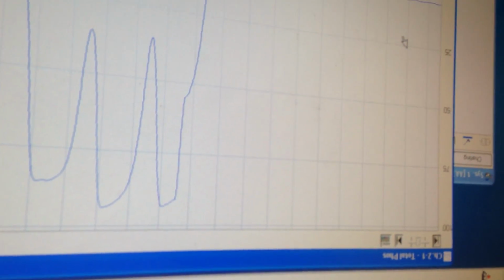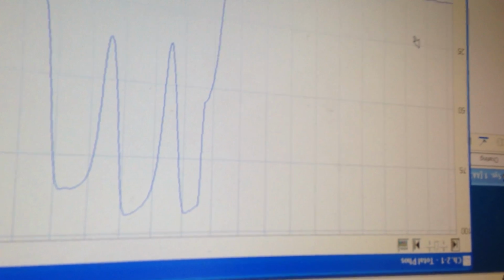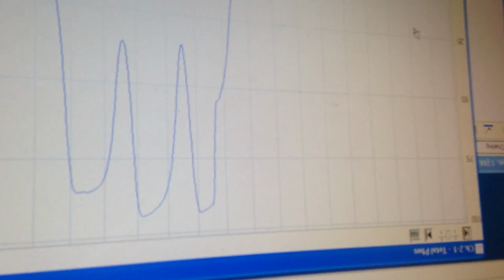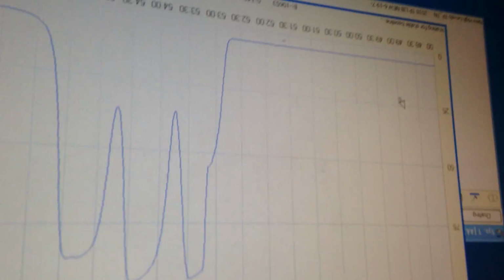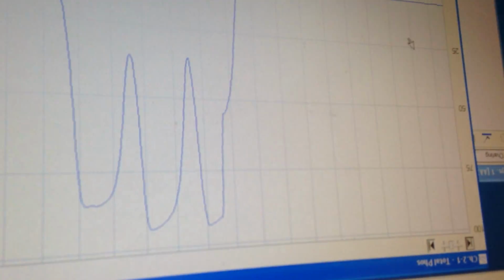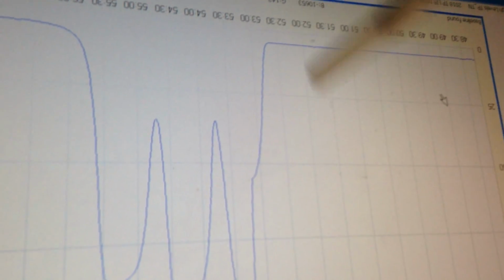If you, I don't know what the word is, but you can force baseline with that button at this point if you need to. So like on 4 chemistry, when I have all 4 windows, and all three, or the first 3 channels, find baseline of alkalinity is just too much of an unstable baseline. Yeah, you told me that. I'll just force it. Uh-huh. Yeah. And baseline is found, and then the button actually disappears. And it disappears. Yep.